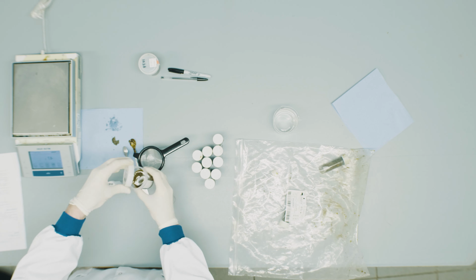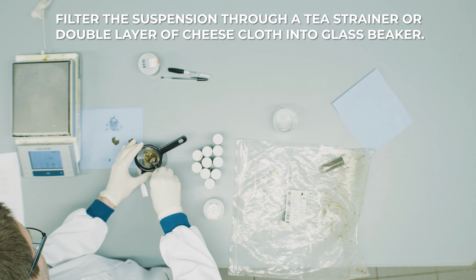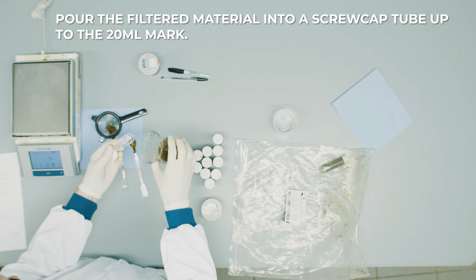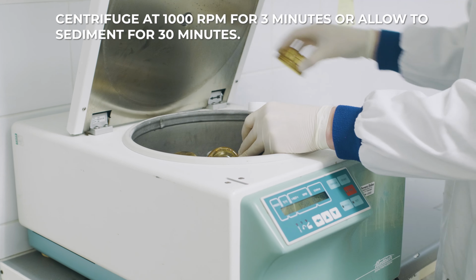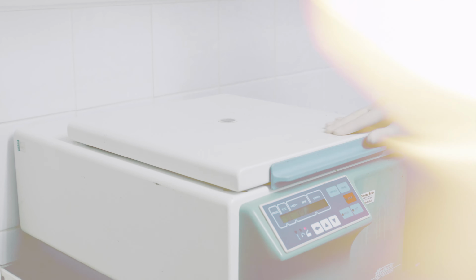Filter the suspension through a tea strainer or double layer of cheesecloth into a glass beaker. Pour the filtered material into a screw cap tube up to the 20 ml mark. Centrifuge at 1000 RPM for 3 minutes, or allow to sediment for 30 minutes.